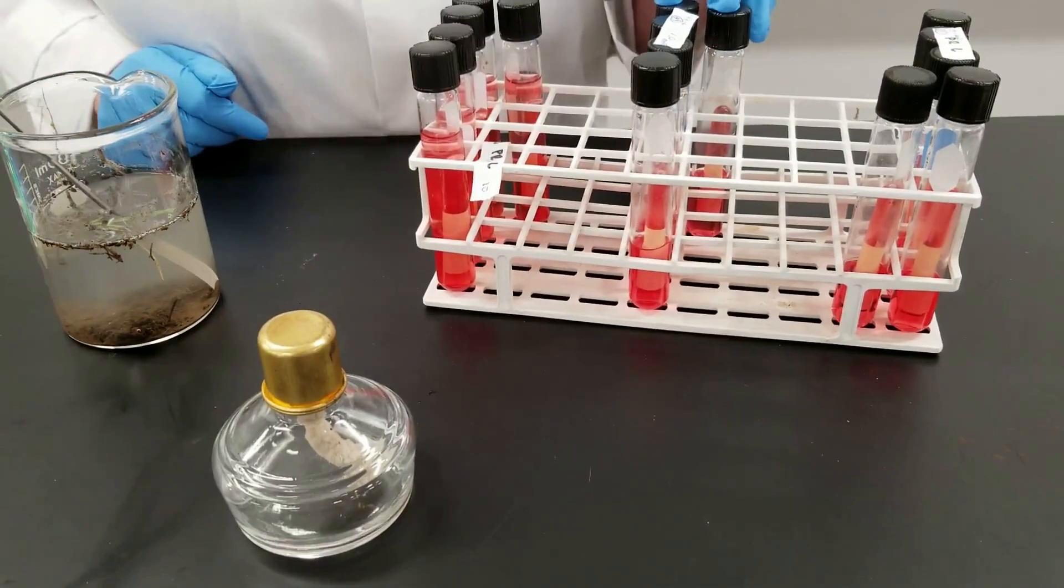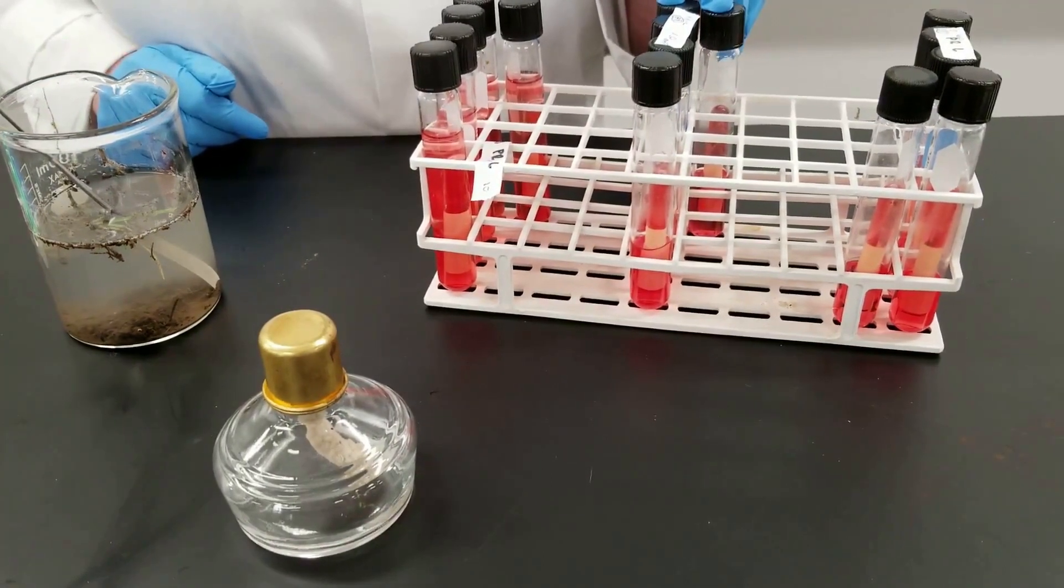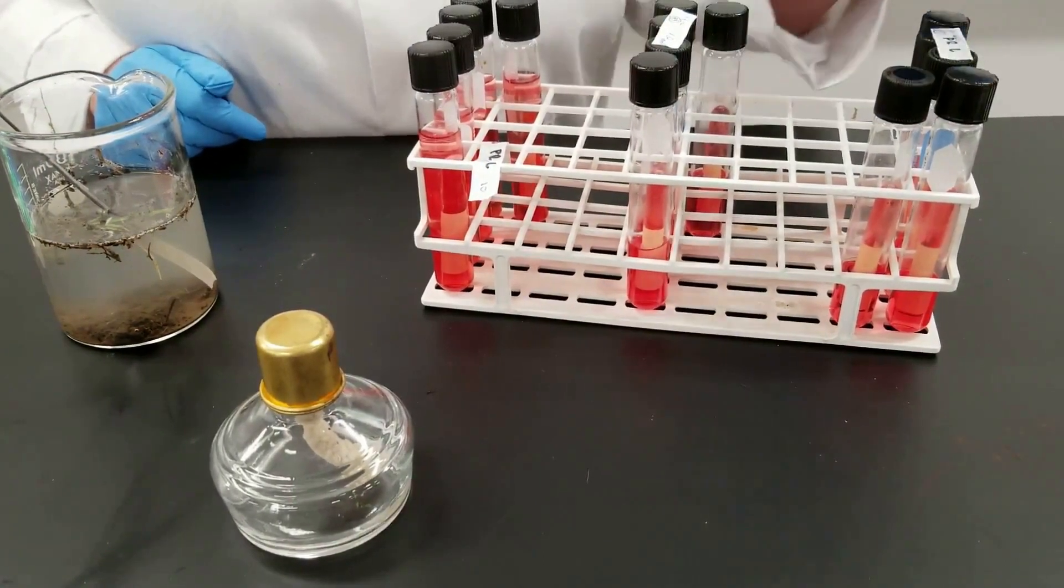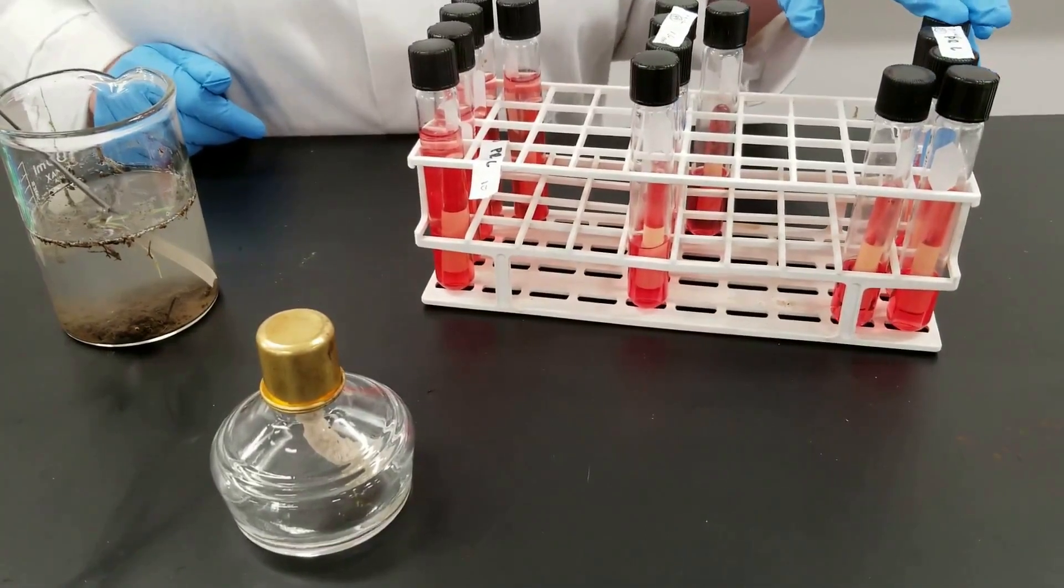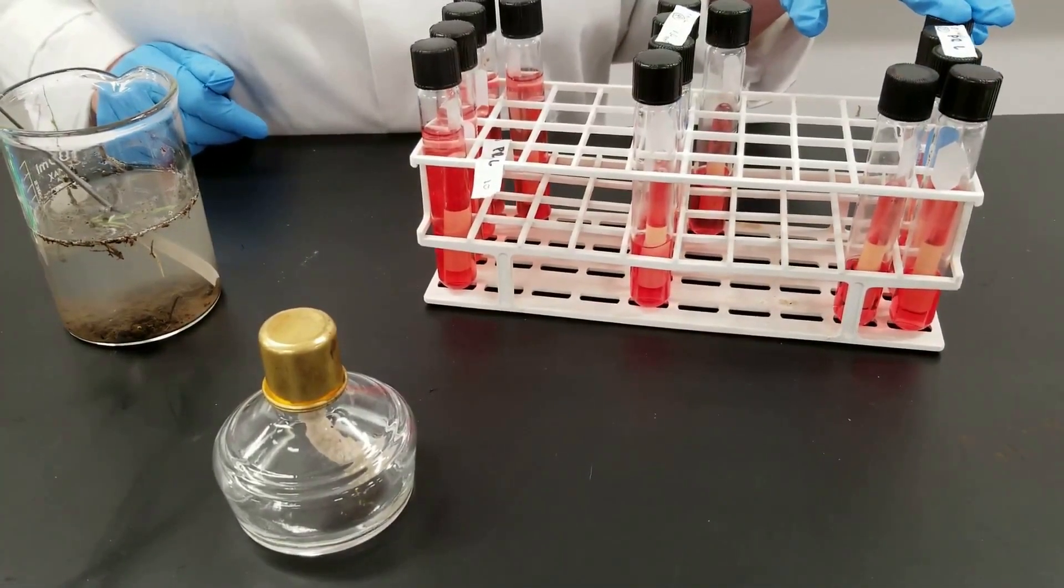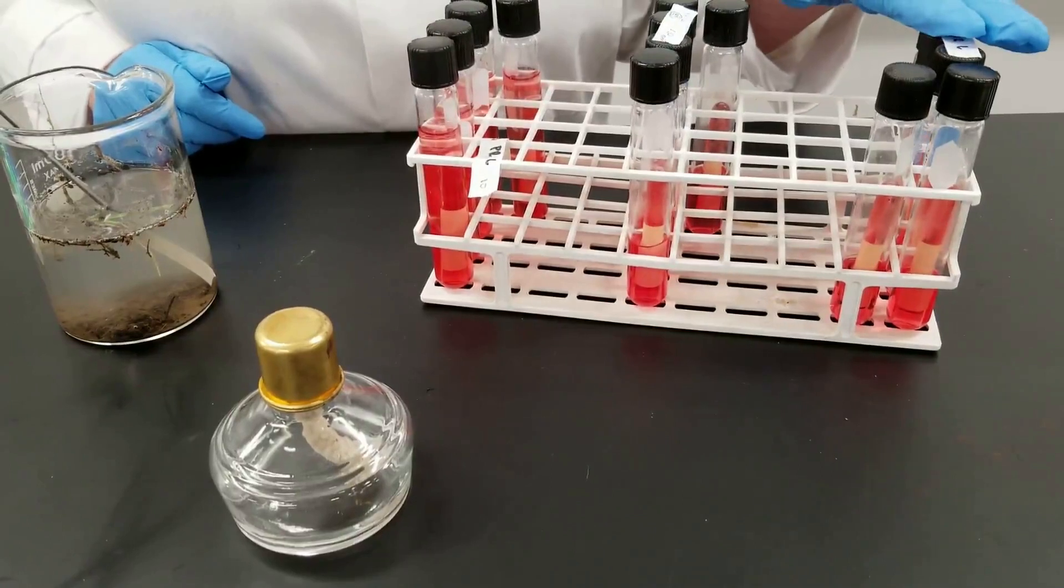And I put one milliliter of water, and then in the last row over here I only put 0.1 milliliter of water. So you have three different dilutions.